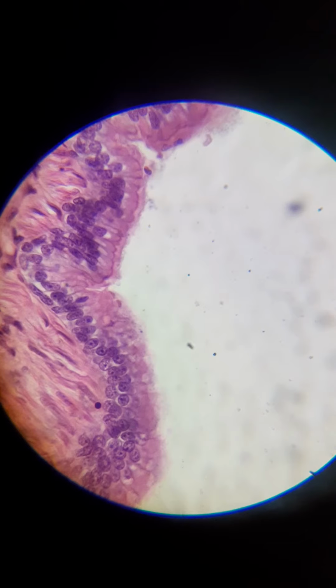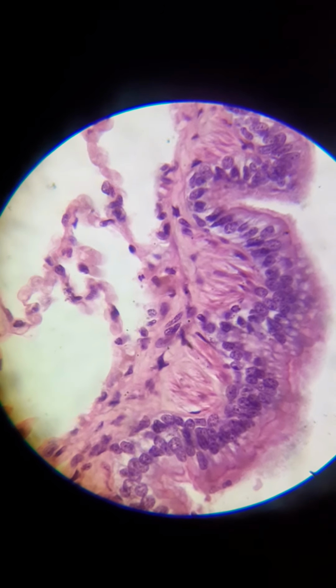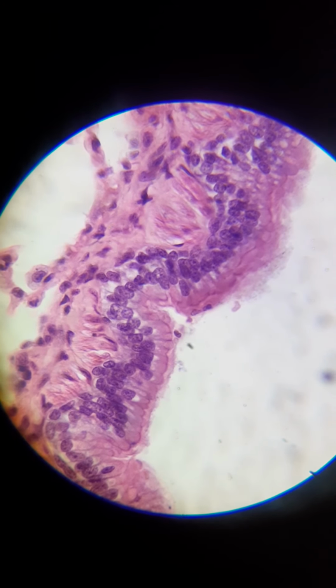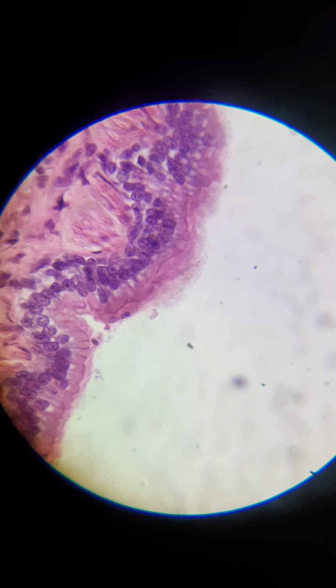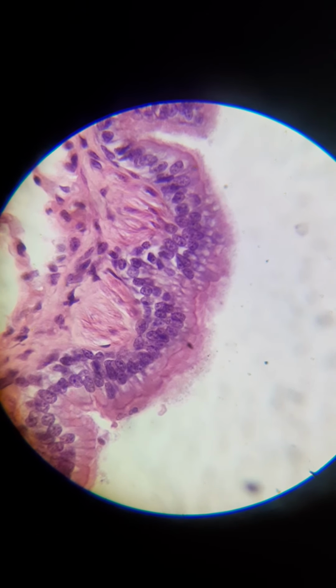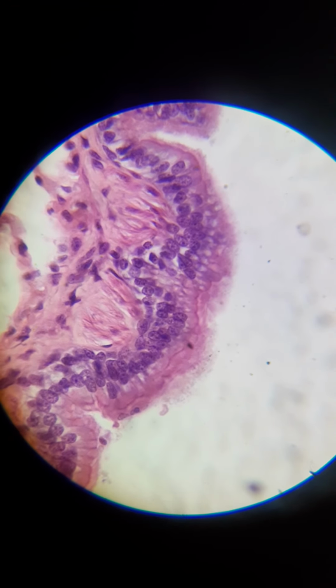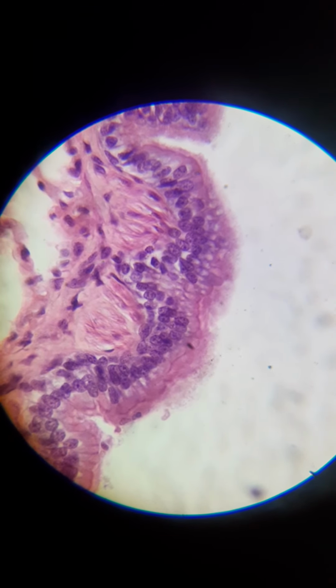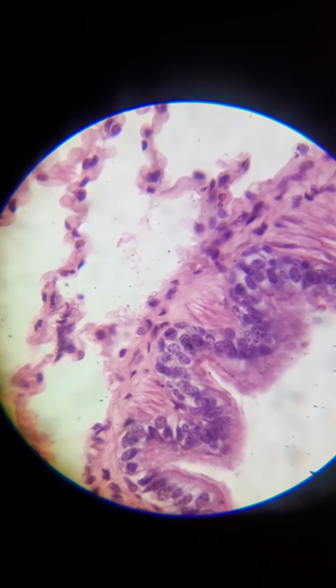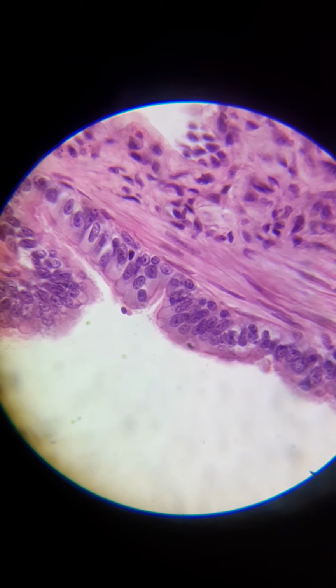All right, so these cells at the top are called columnar epithelial cells. Different cells have different types of names, just based upon their shape and what they do. So these are actually columnar ciliated epithelial cells. They have cilia, which move mucus. Okay, so mucus is actually being secreted. So all of the dots here are the nuclei of these cells that make up the border.